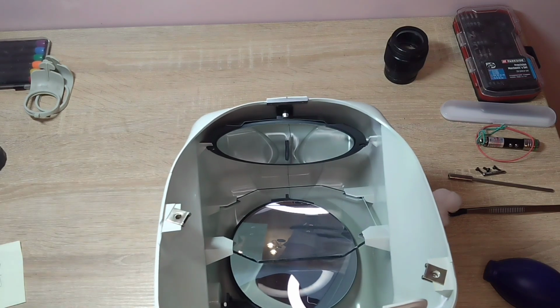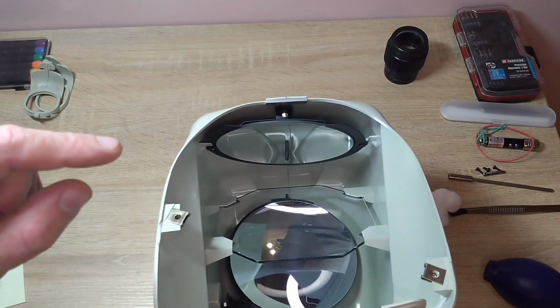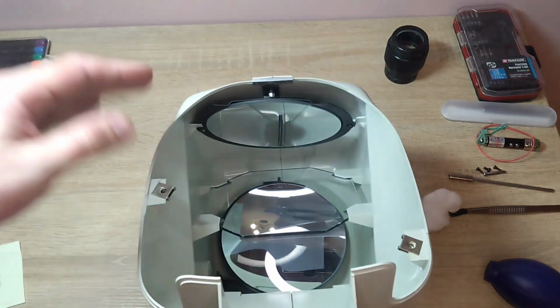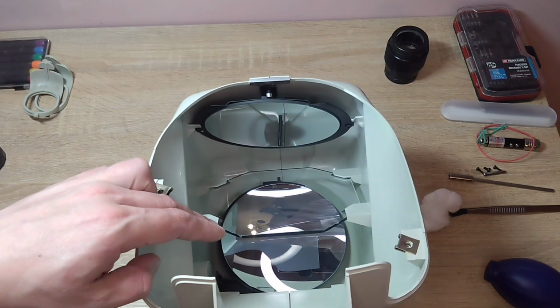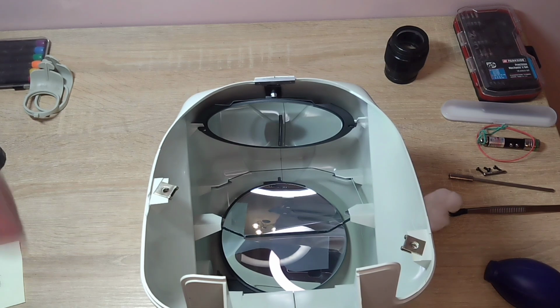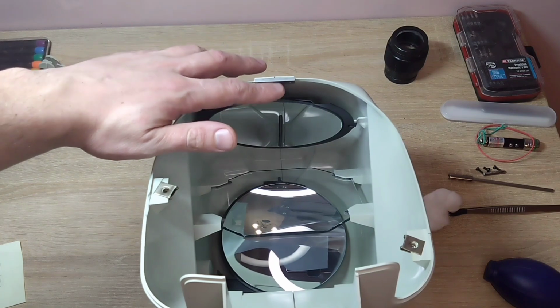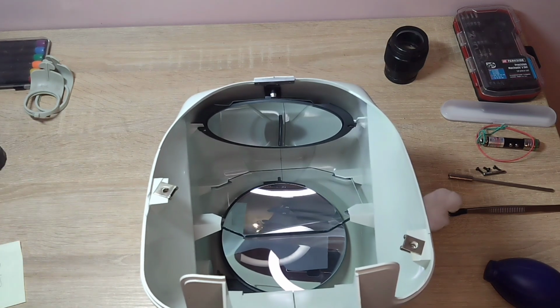And in the middle, at an angle, I'm not sure what the exact angle is, possibly 45 degrees, there is a semi-transparent mirror. It transmits part of the beam and reflects part of it. On this side is the screen. This is a magnifying lens. When one image hits this semi-transparent mirror, part of the image goes down, reflects off the lower mirror, returns back to the semi-transparent mirror, and then reflects onto the screen. The other part, more precisely the first beam, which is not flying but spreading, goes down to this semi-transparent mirror, reflects off this mirror, and then hits the screen. And in this way, two images are produced.